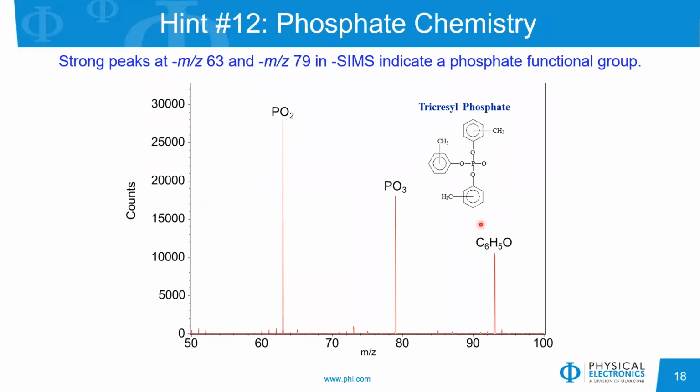Phosphates will produce secondary ions in the negative ion polarity at a mass to charge ratio of 63 and 79. So here we're looking at a sample of tricresyl phosphate. And so we see the C6H5O ion, and we also see the PO2 and the PO3 from the phosphate group. So those will always be very strong, very intense peaks.